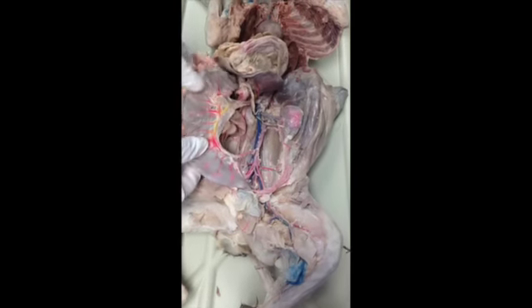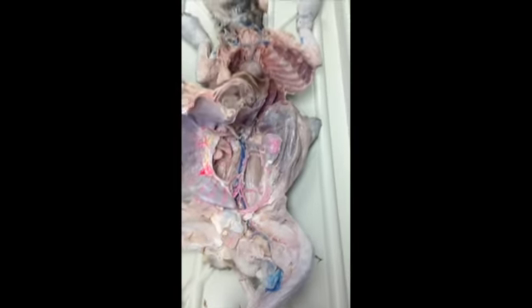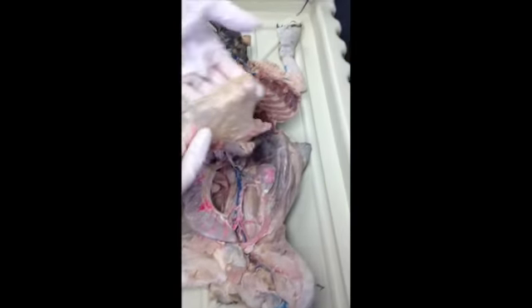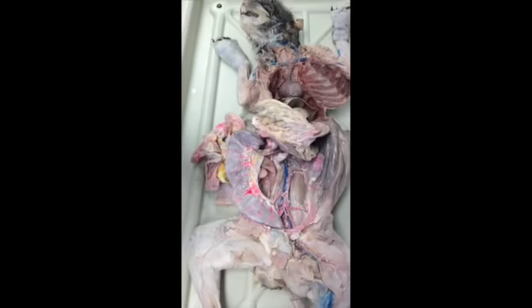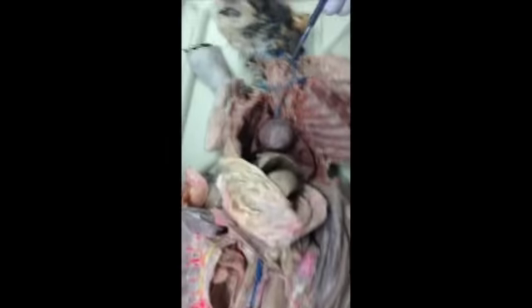I think so. Okay. This cat, I hope it's used for everything on the practical. It'd be easier, but it's still gonna be very similar. I mean, he's not gonna pick an internal jugular that's not there. What is supposed to be here? What's missing?